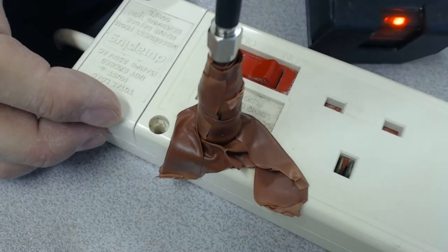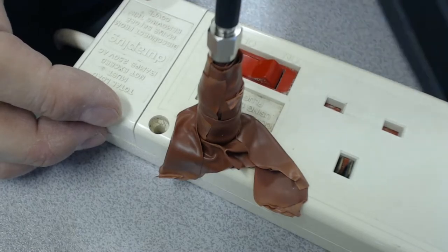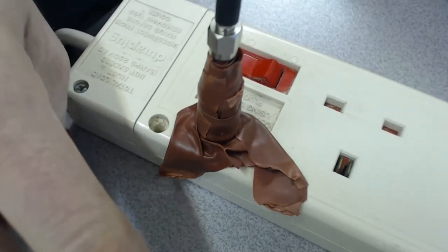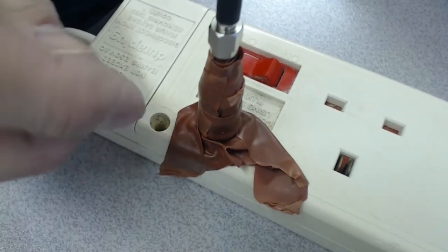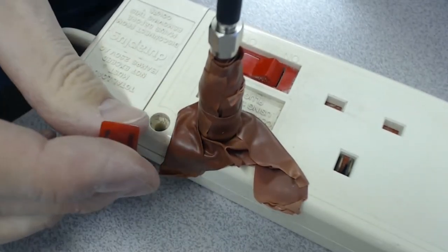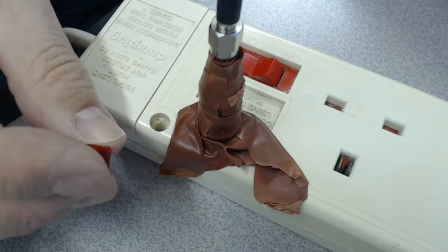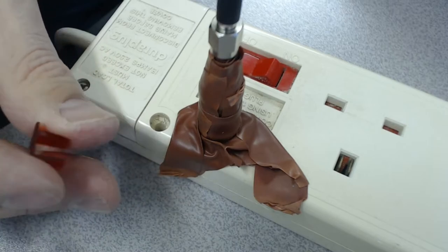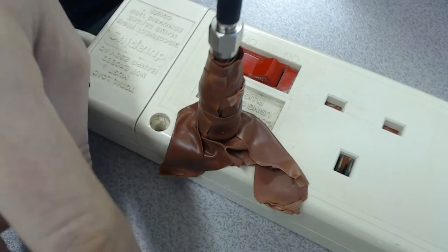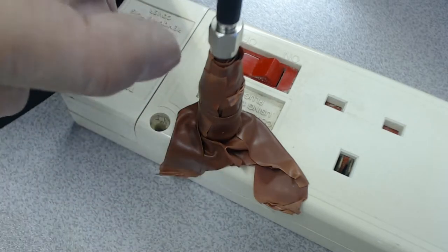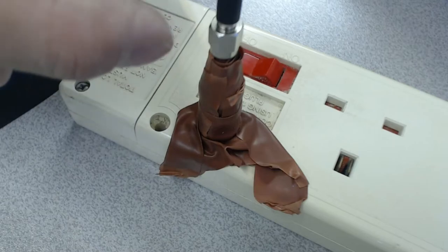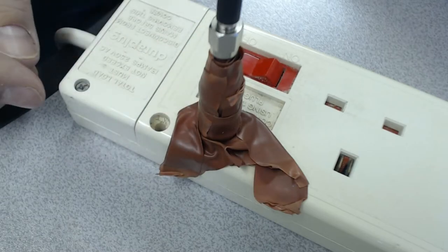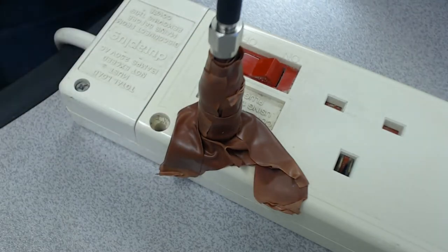I'm showing you at the corner here. I've actually got one under here and what I've done is I've popped off this little red piece of plastic that goes on top so that the spectrometer's head can look at the bulb in there.